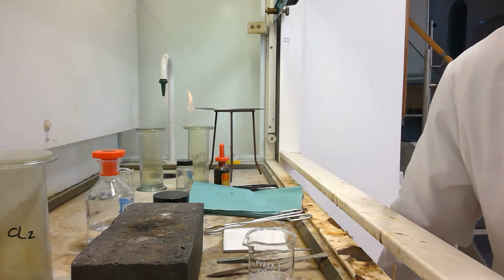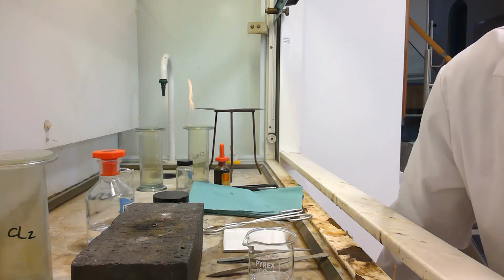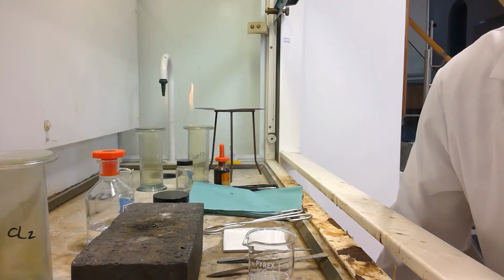This is a video to look at the reaction between sodium and chlorine. It is a good example of the formation of an ionic compound. Sodium, which is in group 1, has 1 electron in its outermost shell.